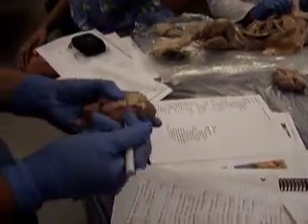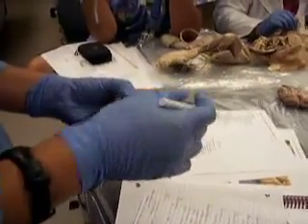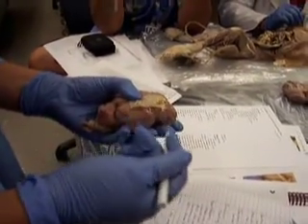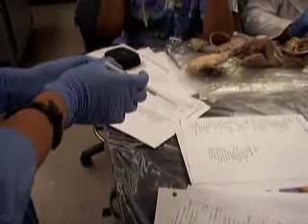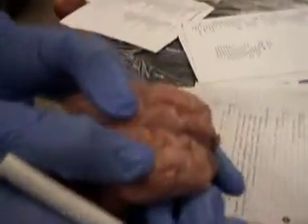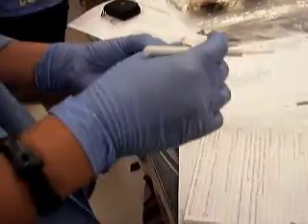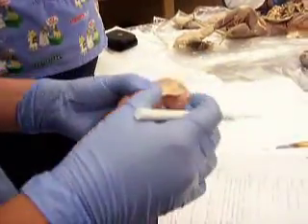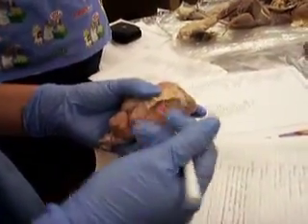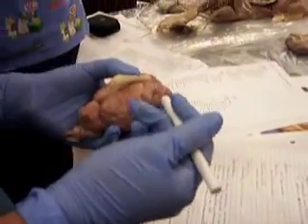So this is dura mater. Technically it's from the vertebrae, but it's the same material. So the hard outer portion is the dura mater. The part that's right on top of the brain, you can see the little connective tissue that kind of moves around. That's the pia mater. It's a little thin layer, and in between the dura mater and the pia mater is the arachnoid space, and that's the space that looks like a spider web, hence the name arachnoid space. So those are the meninges. The dura mater, the arachnoid space right in between, and the pia mater right on top of the brain.